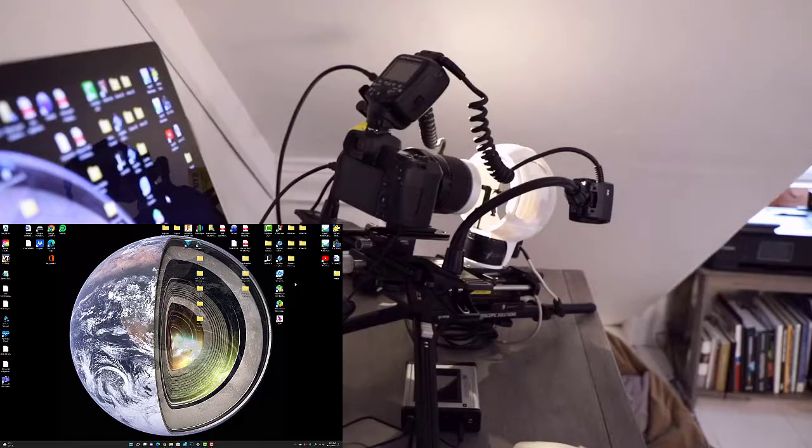Mark with Macroscopic Solutions, and what we're going to be photographing now for you is the same black specimen that we had before. So this is a bumblebee. Only this time what we're trying to do is capture a full lateral view. So basically a pretty standard 2D image of a specimen that would be housed within a museum collection. So we're not magnifying this specimen at all.